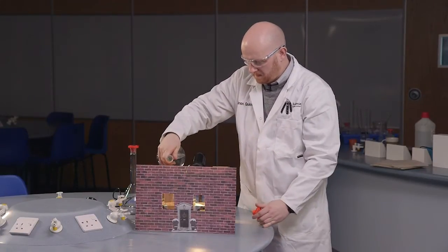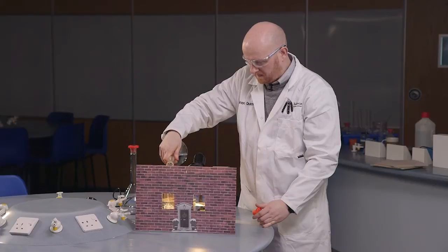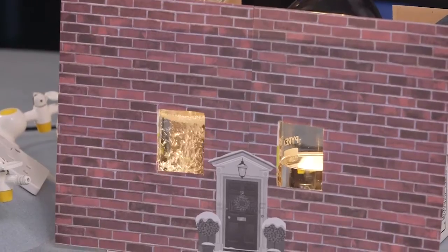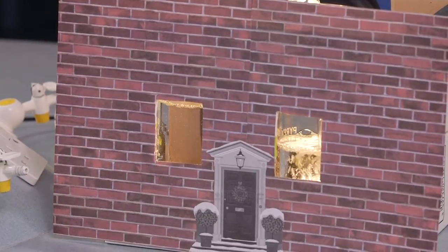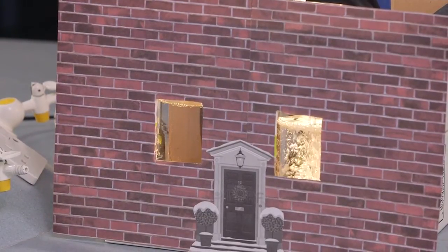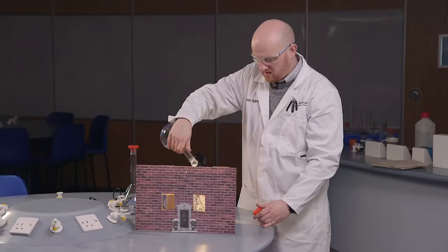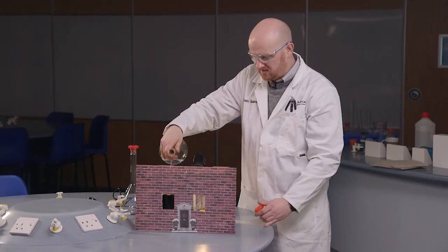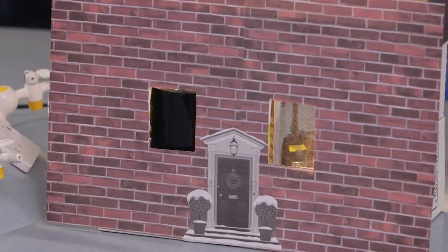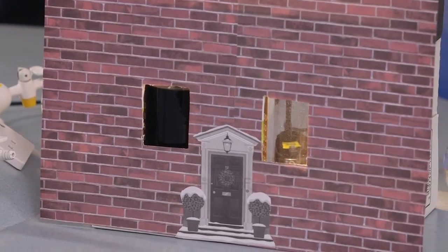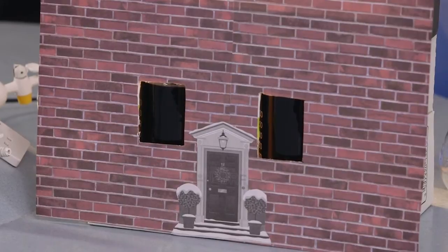So that's into one beaker. Into our second beaker. And we should start to see, there we go, there goes one really quickly. And hopefully after 10 seconds, there we go, there's a second one.